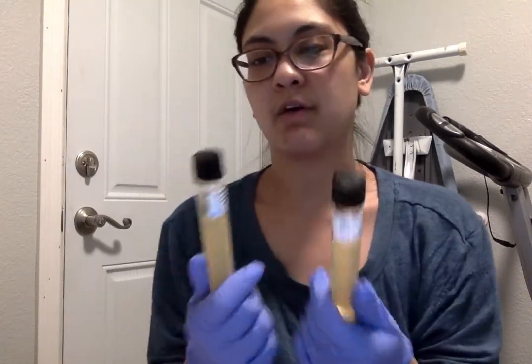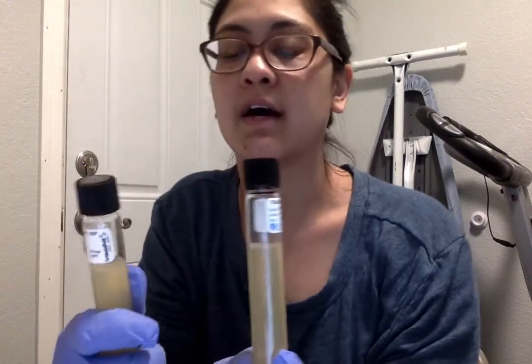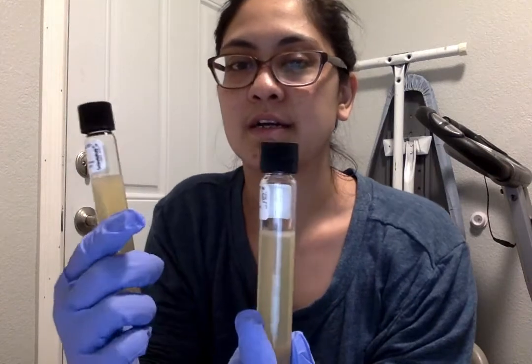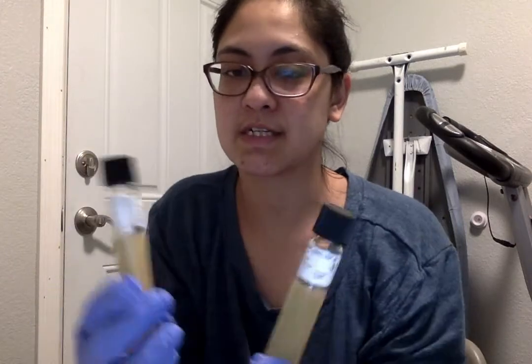It's Sunday, November 24th. This is for the lab bacteria identification motility testing. I have here my developed tubes of E. coli and S. epidermidis, and I was a little skeptical at first when I had done these. When I was puncturing the agar, I thought to myself, there's no way that anything was going to grow. It's so thick, it's so opaque. If anything, there would be just growth on the top. And in both cases, yes, there was growth on the top.